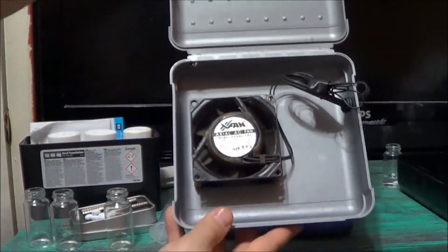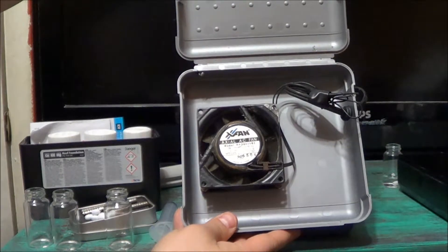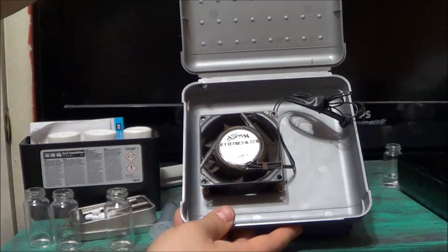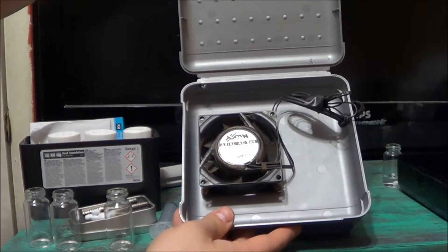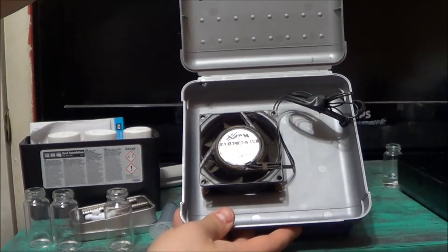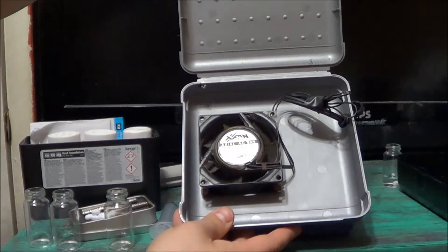But all I did was just mount a fan on the inside and I glued some neodymium magnets on top of that fan so when it turns on, it will spin the magnetic stirrer.